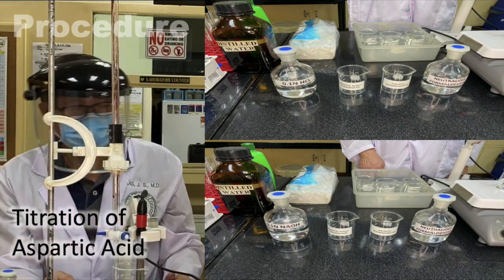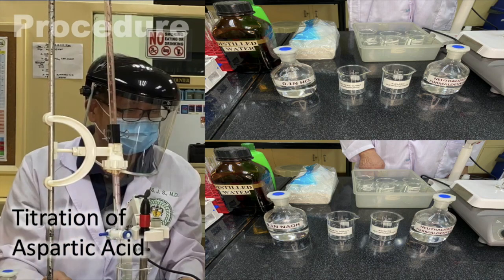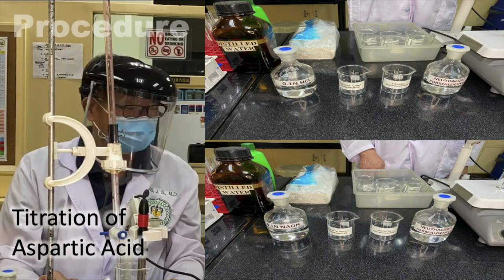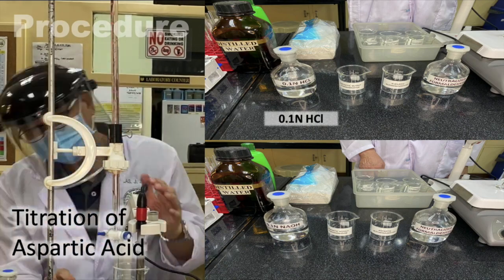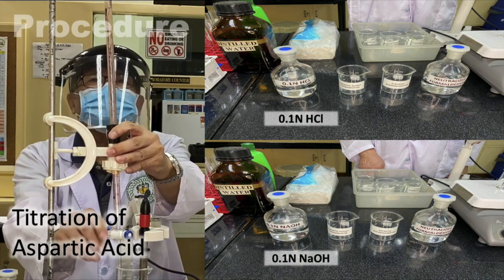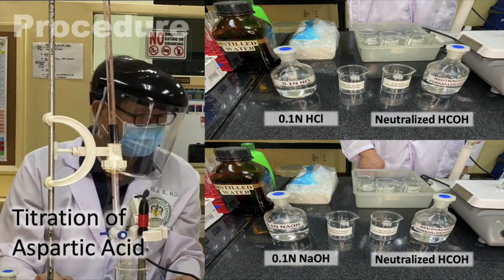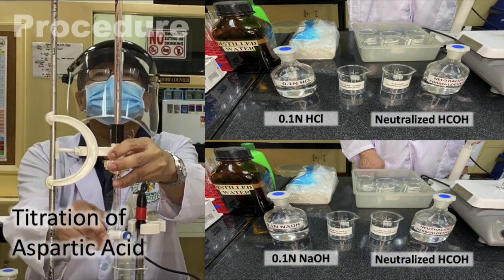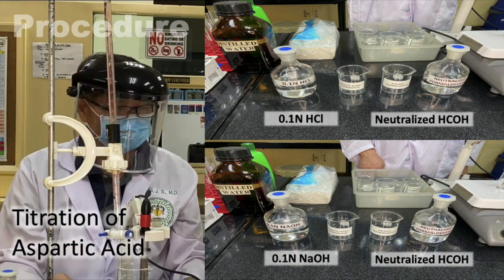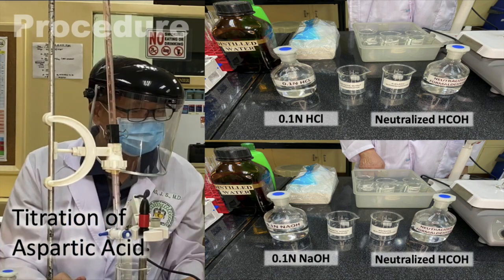The same procedure is repeated for the titration of aspartic acid. The pH readings of the titration of aspartic acid while being titrated against hydrochloric acid and sodium hydroxide are likewise recorded and tabulated. Additionally, neutralized formaldehyde-treated aspartic acid is likewise titrated against the acid and against the base, with the different resulting pH readings recorded and tabulated.